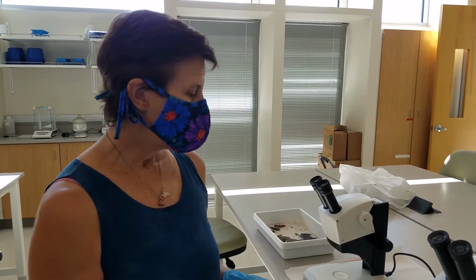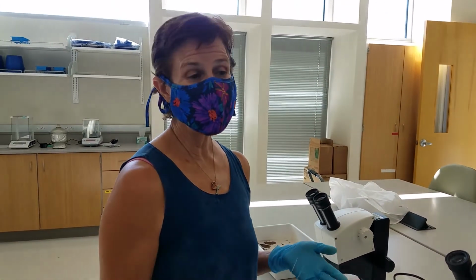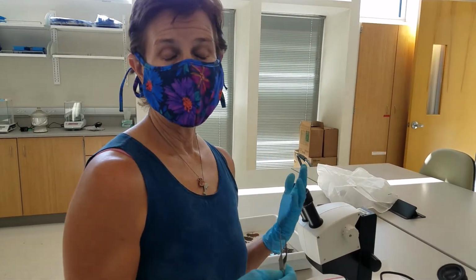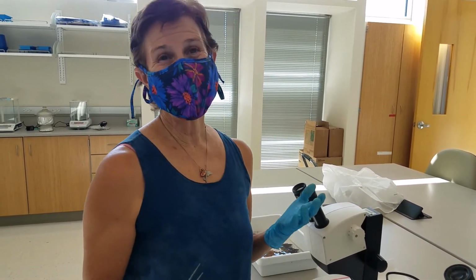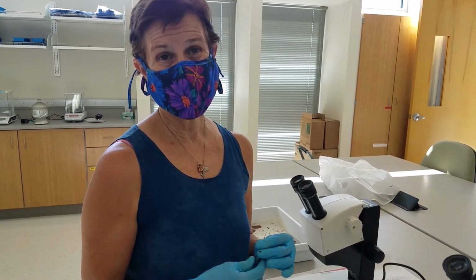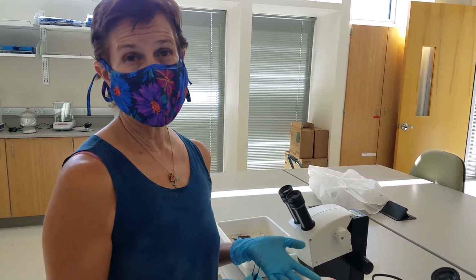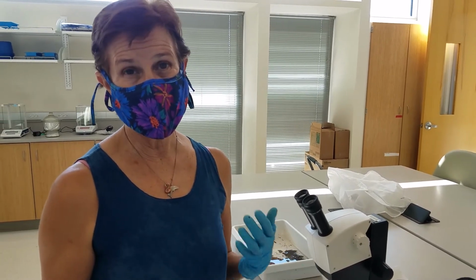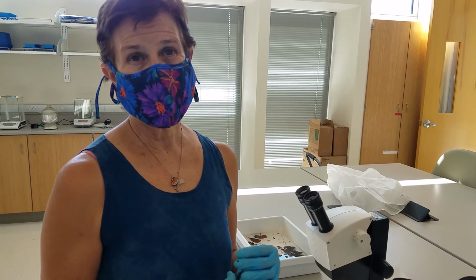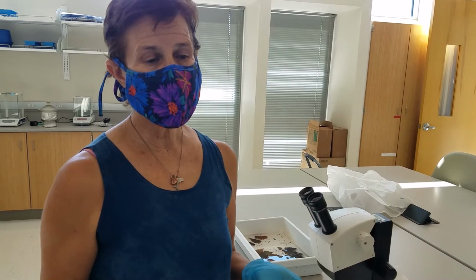So that's sort of the essence of the procedure, and I can tell you that this one, because usually our samples are a lot denser than what Stephanie and I collected at the stream a few weeks ago, it can take a really long time to go through these samples. We often have to subsample, so we'll only look at half of the sample rather than the entire sample because there'll be a lot in it, and it takes a long time to ID it and count. So you do have to use strategies like that.